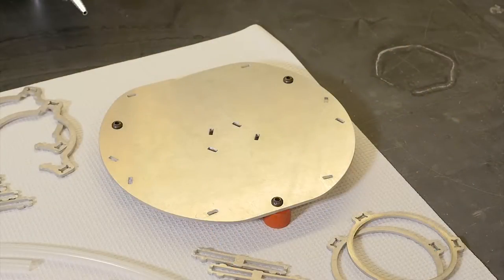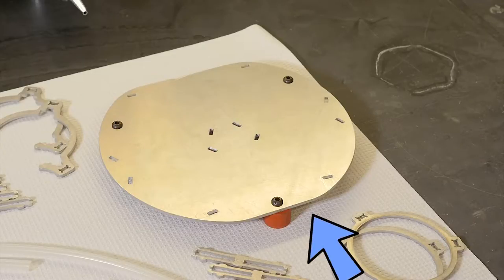The elution device base plate is shaped like a rounded trapezoid. The shorter side is the front, and the longer side is the back.